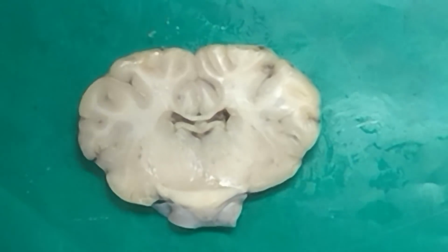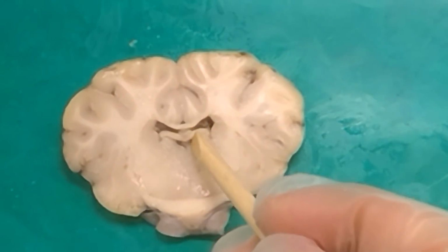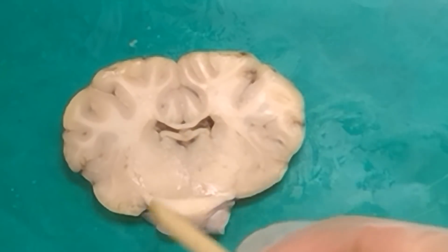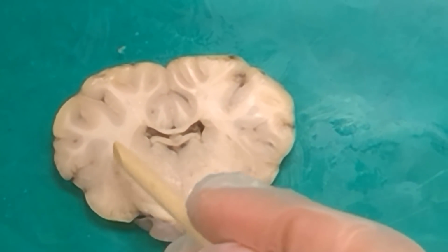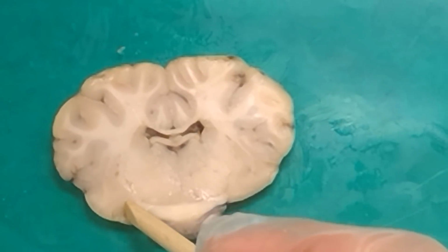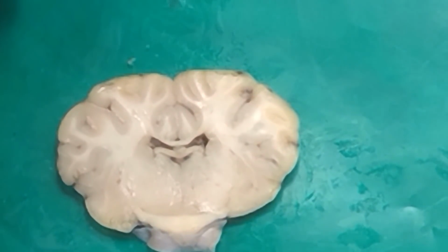We don't see, in fact, you can see we've moved past that optic chiasm. So we should be out of basal ganglia country at this point here. We're moving into the area of the thalamus. We especially know that because we can see the third ventricle here. So we know that we're not going to be seeing claustrum or anything like that. That's how you know you're going to be probably seeing the amygdala over there. So if you see the amygdala, you won't see claustrum.